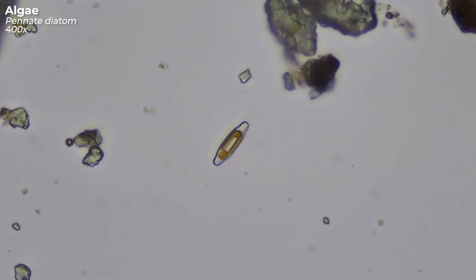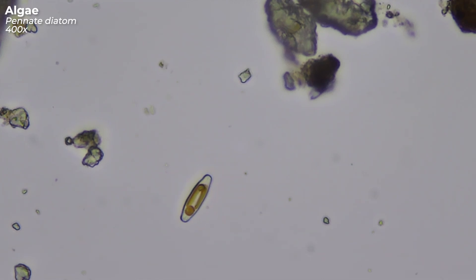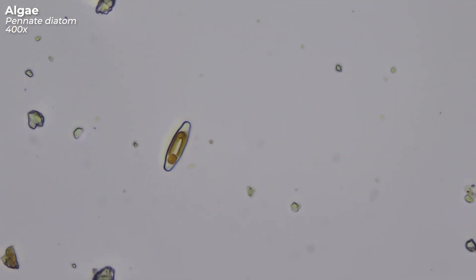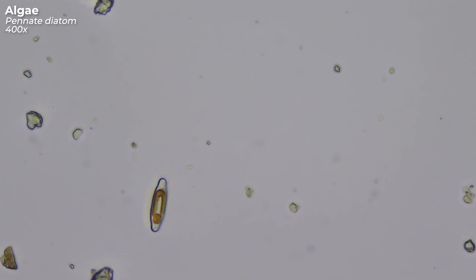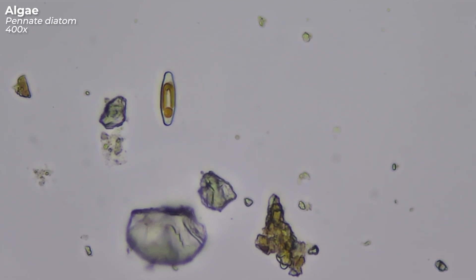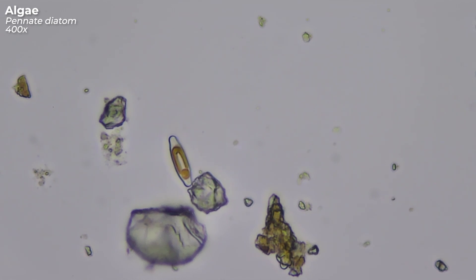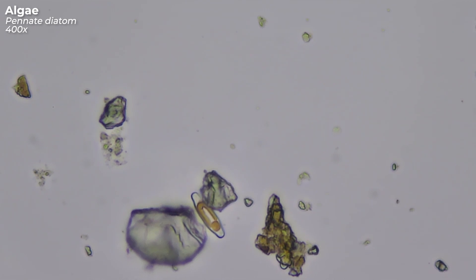And then I came across this strangely moving thing. This is a type of algae, more precisely a microalgae, and it is called a diatom. Diatoms are also found all over the world, and they have an almost infinite variety of shapes and sizes, like snowflakes. Have you ever seen those brownish slimy sediments at the bottom of puddles, or that strange brown coating on the surface of aquatic plants? Well, those are clusters of diatoms. This diatom here can move around with the help of its raphe — a slit-shaped opening from which it secretes a type of mucus that allows it to glide on a surface.